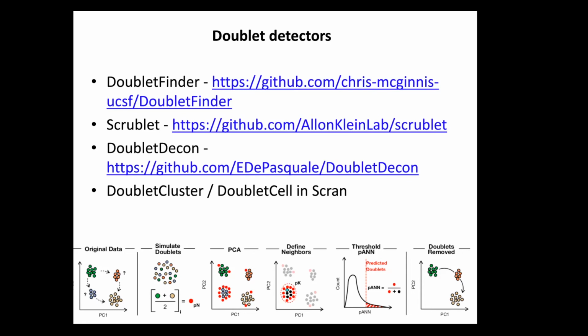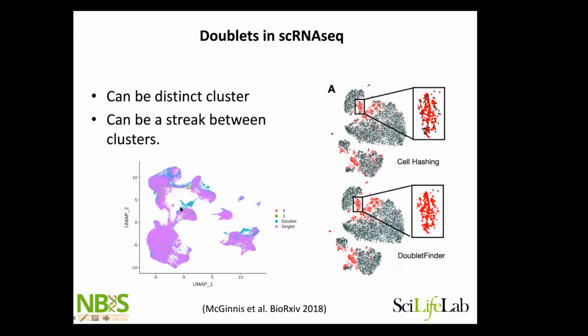Yeah, but then of course, I think it's also going back to knowing the biology of the system you're working with. Because in this case, I colored them by what I predicted to be doublet using a doublet detection package. So all of these in cyan here are predicted doublets. This is a really overloaded sample, so we had quite a lot of doublets also. And then really looking into the signatures of these, especially here we had 2 different cell types that we know we shouldn't have an intermediate of. So then I really trust it. On the other hand, along this path, we actually do have a differentiation pathway going on. So it might actually be the case that some of the predicted doublets here are falsely predicted. So it's really going back and forth with the data and thinking about what you have.